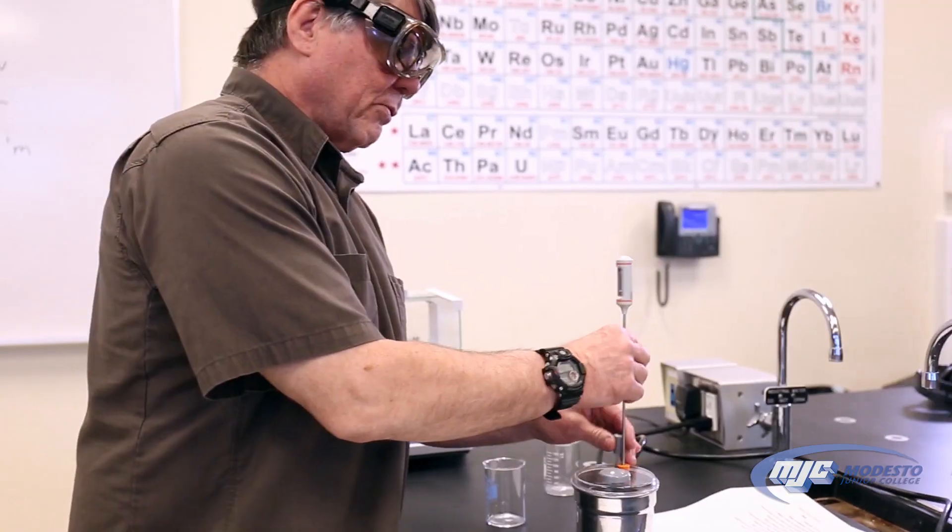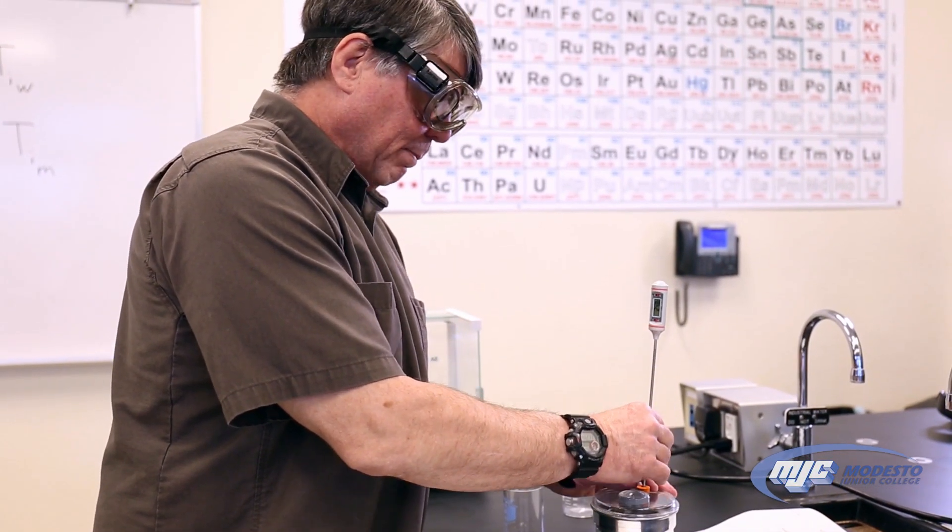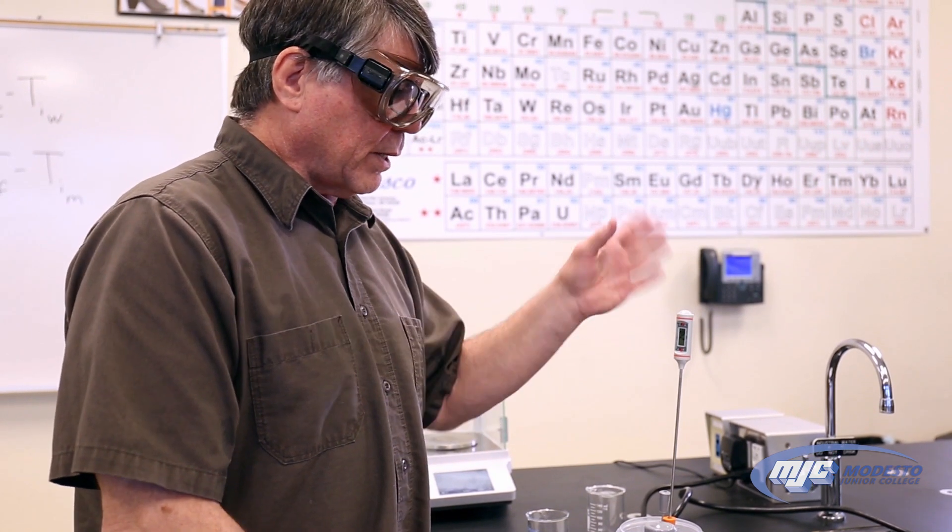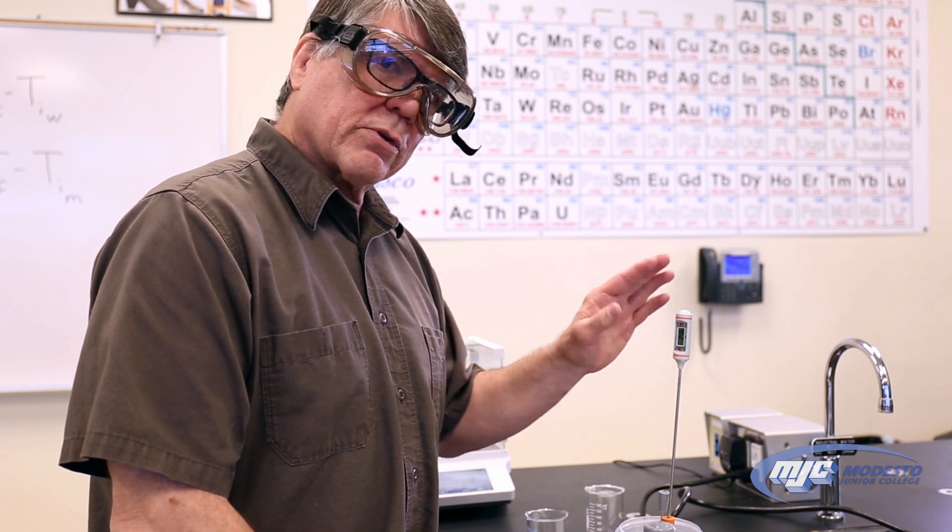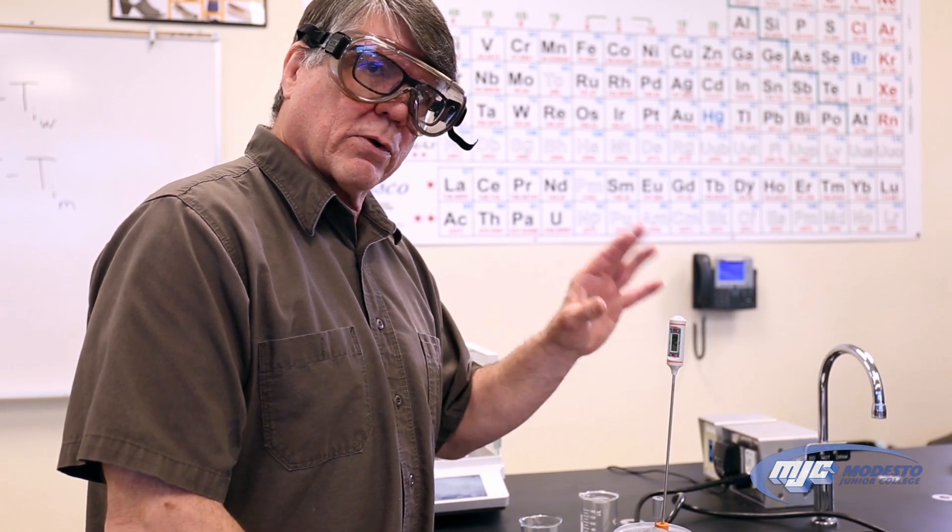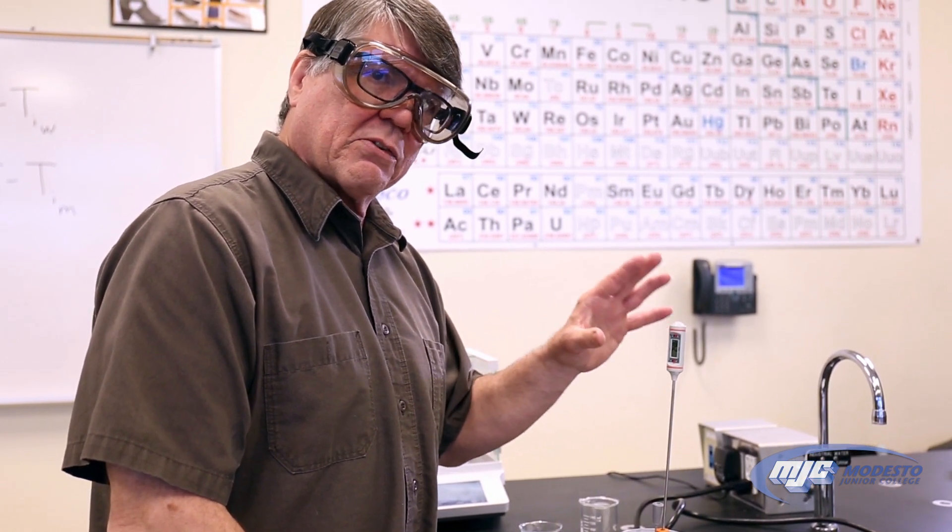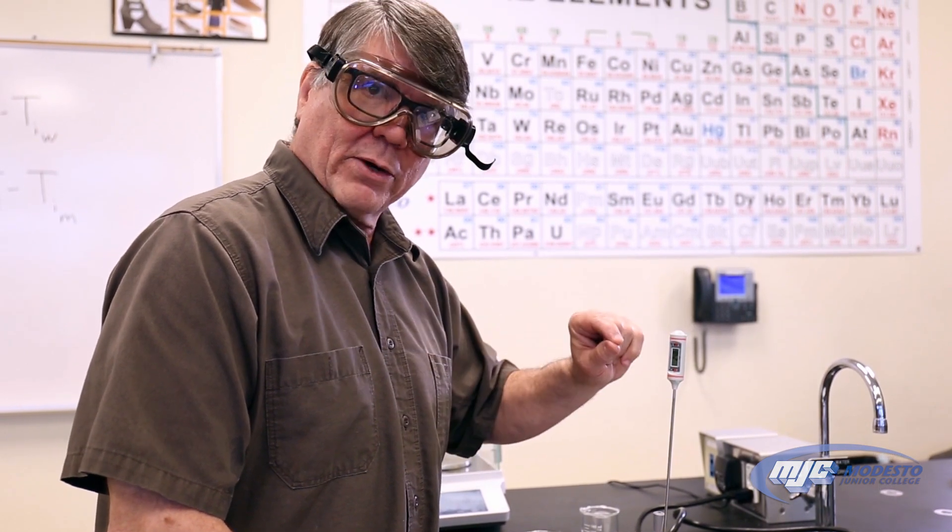All right. So we've been measuring the temperature every 15 seconds and filled out our data table when we're done. We need one more number, and you kind of get that in the calculations when you're doing your lab report. But the idea is that this temperature is going to stay pretty much the same for a while. The temperature that it stays at the longest, that's your final temperature, both of the metal and of the water. And that's the last number you need.